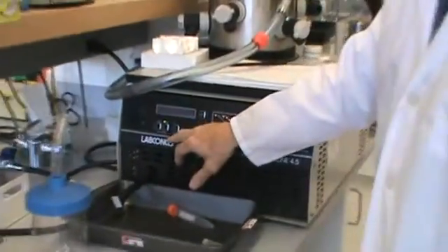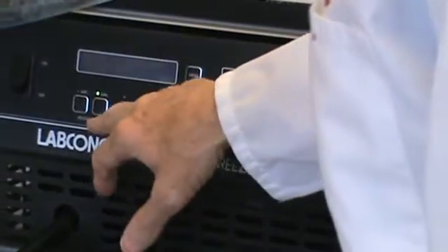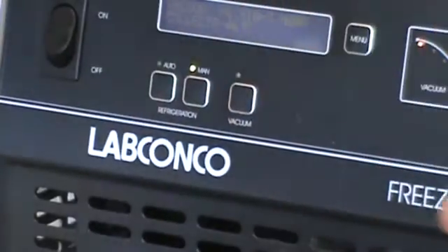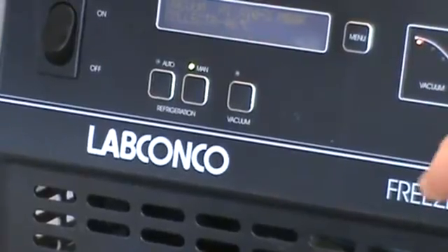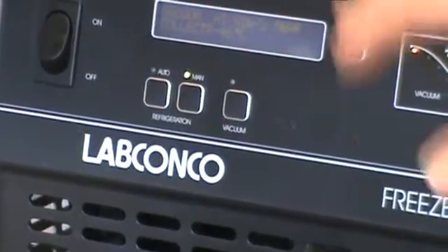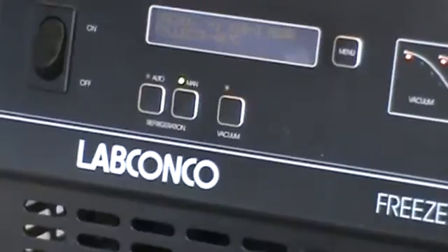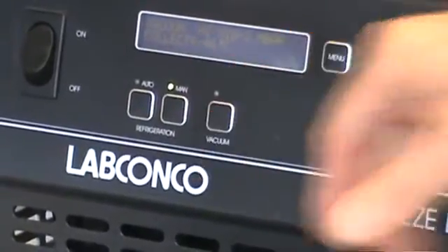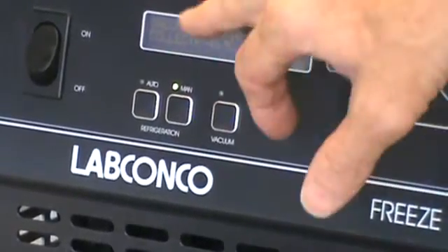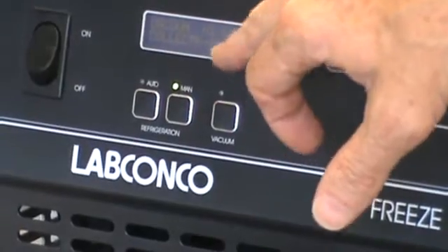Then you can turn it on, which has already been turned on with the manual. You can turn on manual or auto. With auto, refrigeration goes on first, and as soon as the refrigeration is cold enough, the vacuum will kick in. So right now this is on vacuum. You can read the two readings in here.